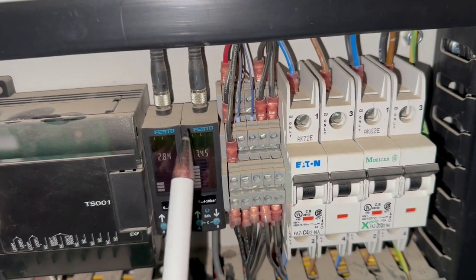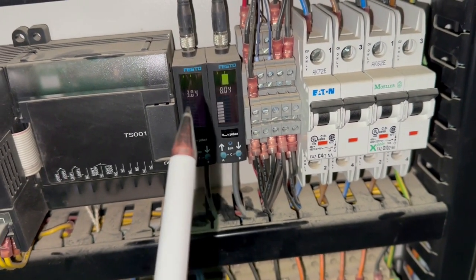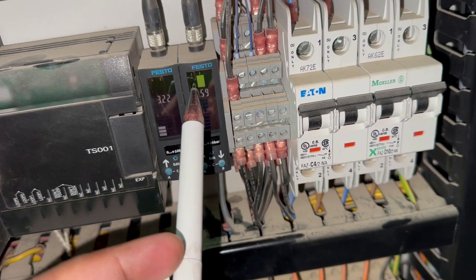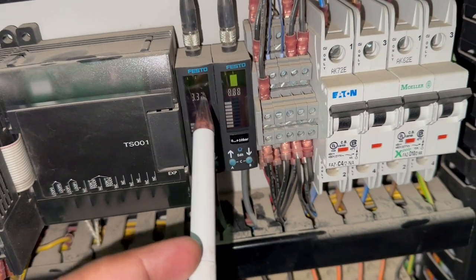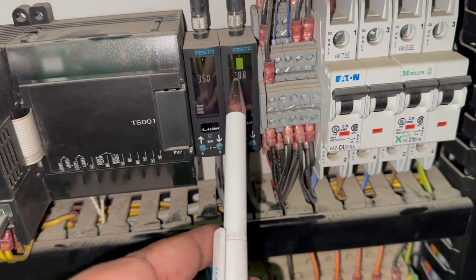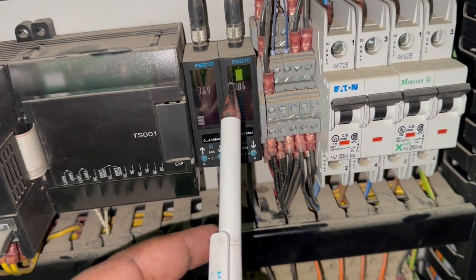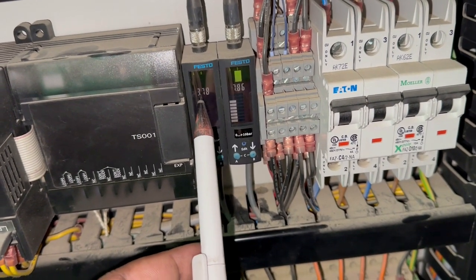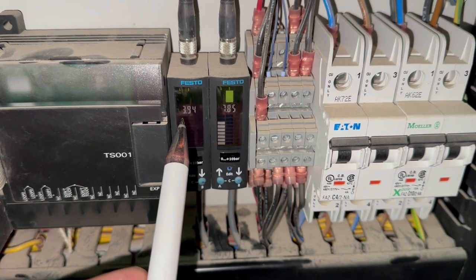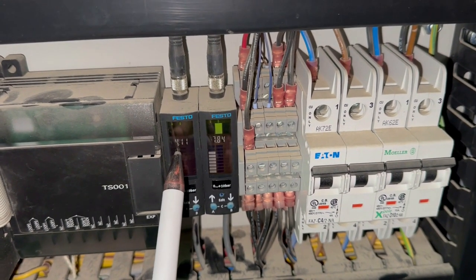Once this pressure is completed, since this is the pressure switch, it sends some signal to the PLC, and then it vents the tank. I think some limit has been reached, so it's set point A, set point B, similarly set point A, set point B. So let's see. Now set point A was just reached and it vented out. Once it reaches this set point, it vents the air, because our main concern is our product. If in this case it vents the nitrogen as well, then we would have to diagnose why it's venting the nitrogen, because we need the nitrogen.